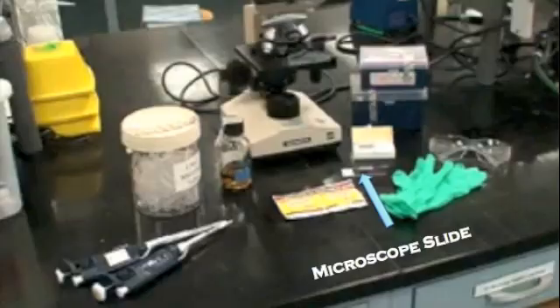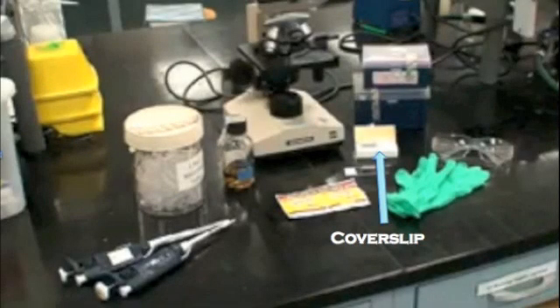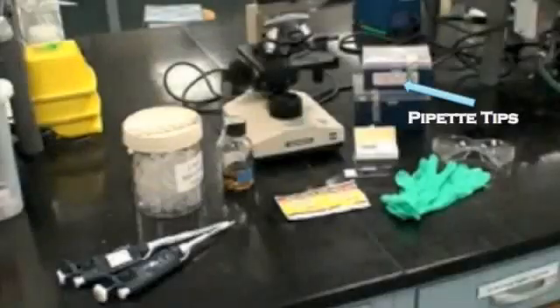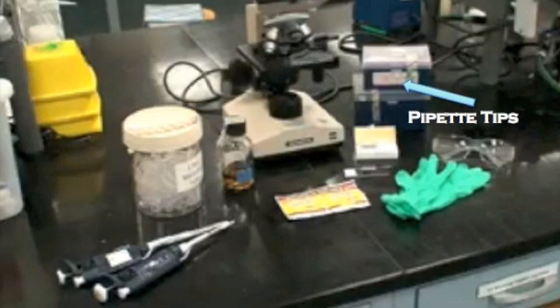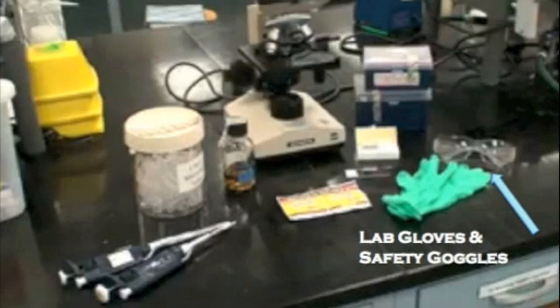You will also need a microscope slide, cover slip, pipette tips, and lab gloves and safety goggles.